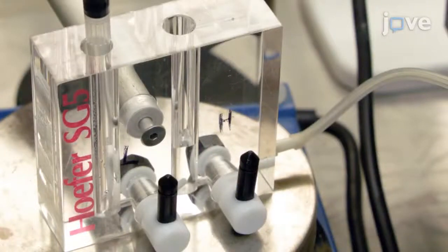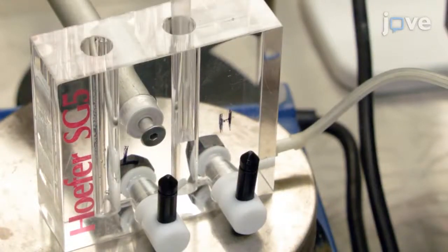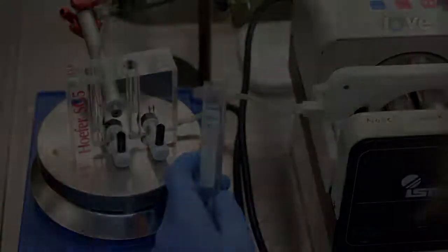Close the valve and pipet the traces of solution back to the heavy chamber. Finally, pipet the 3.5% solution to the light chamber.